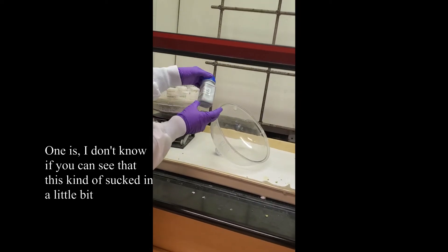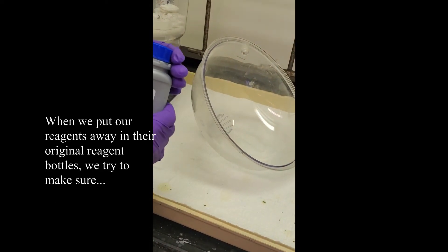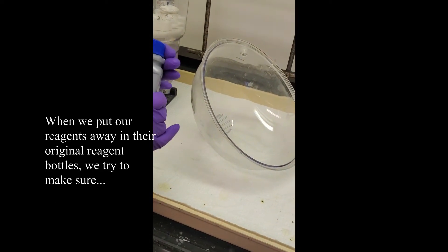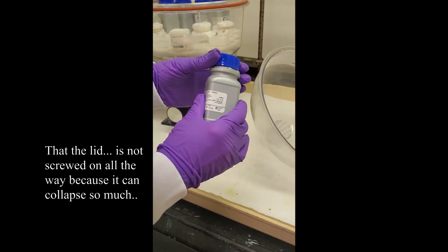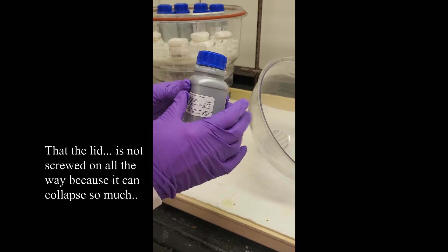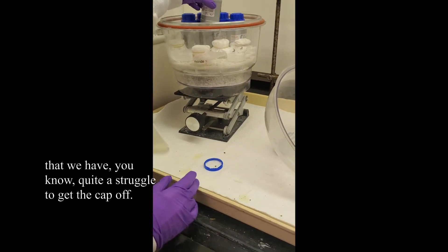One is, I don't know if you can see that this kind of sucked in a little bit. When we put our reagents away in the original reagent bottles, we try to make sure that the lid is not screwed on all the way because it can collapse so much that we have quite a struggle to get the cap off.